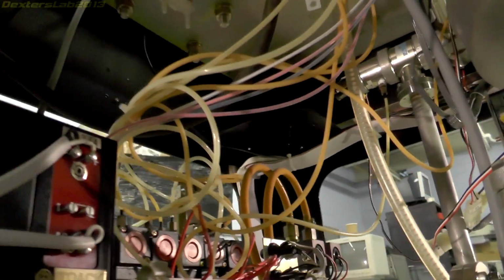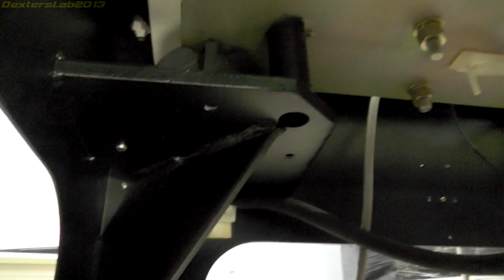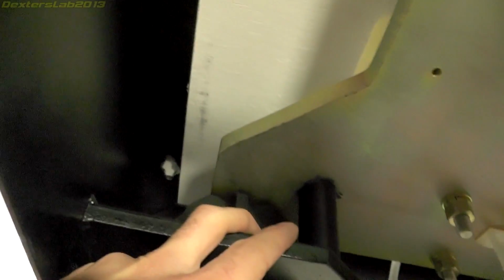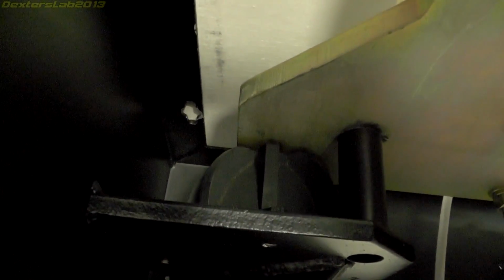As you can see, inside this frame, there's some rather substantial mounts. Let's just turn the brightness up there for you. I mean, that's getting on for 10 mil thick steel. Then on top of that, there's a rubber vibration mount.